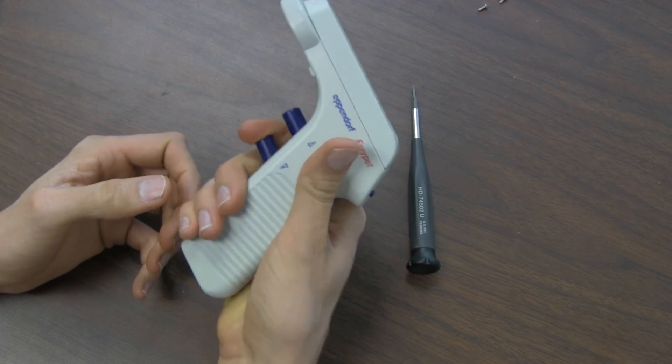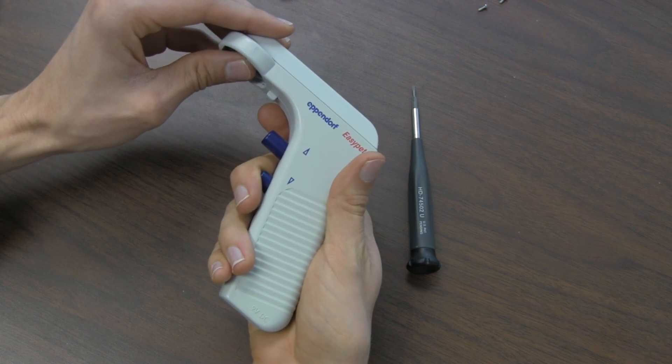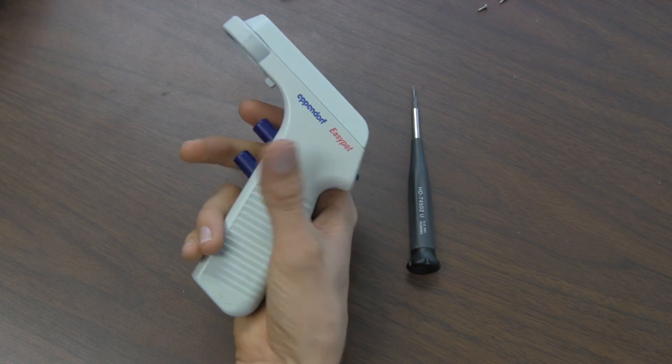And check to see if it works. You can immediately check to see if there's vacuum or pressure just by putting a finger there here.